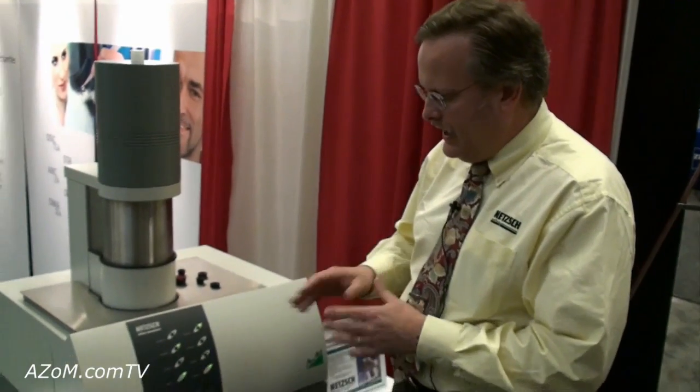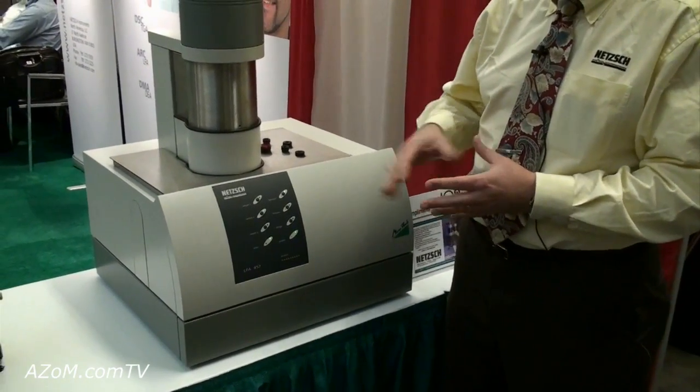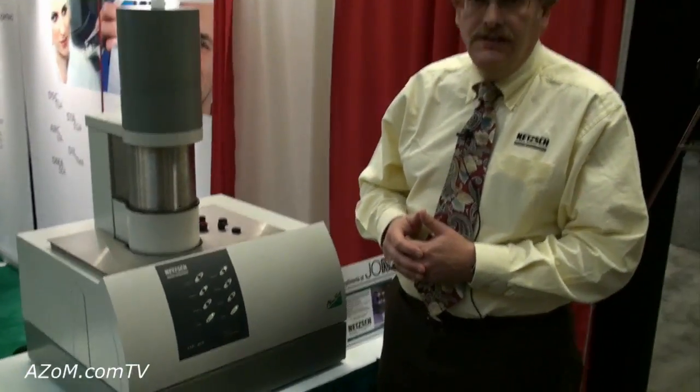The LFA stands for laser flash analyzer, and this particular model is called the LFA 457. We've also got two other models. There's a high temperature system to 2000 degrees called the LFA 427, and then a third model called the LFA 447 that's useful up to 300 degrees — quite often popular in the electronics industry for polymeric materials. That unit does not use a laser; it uses what's called a xenon flash, so the L in that case stands for light flash analyzer.